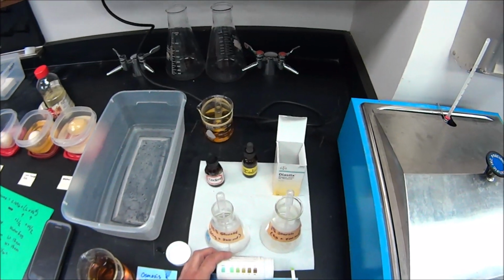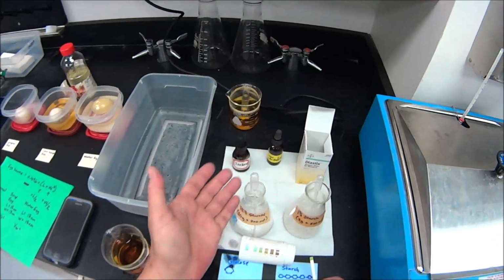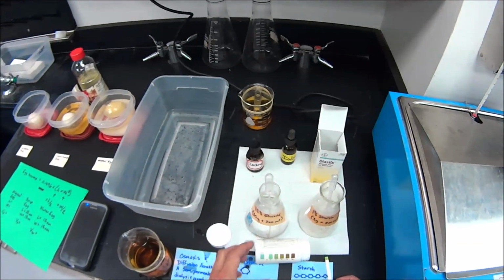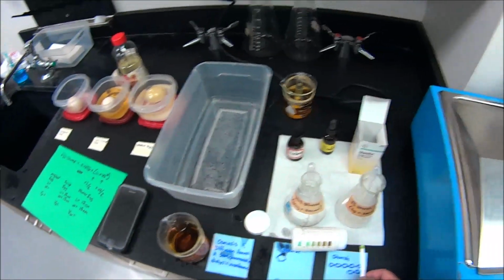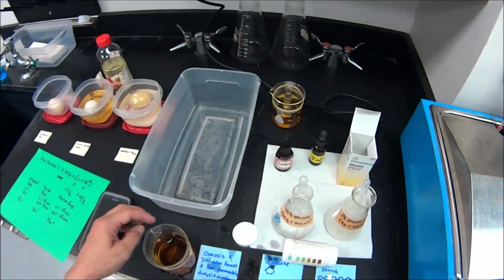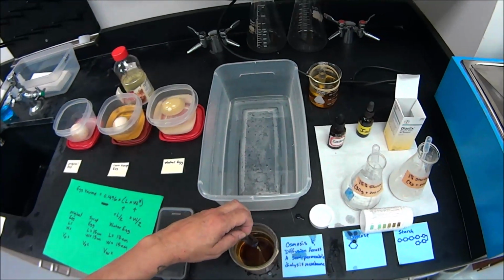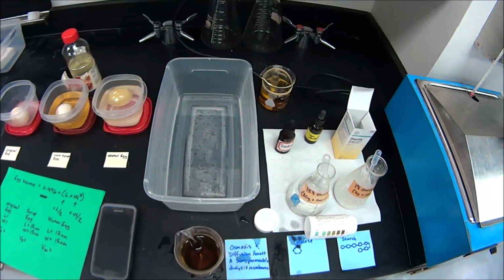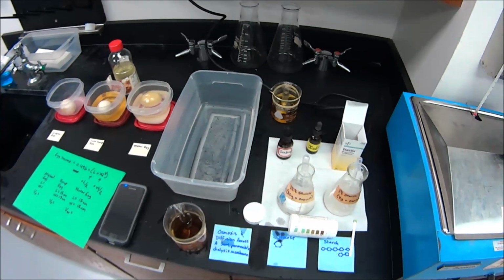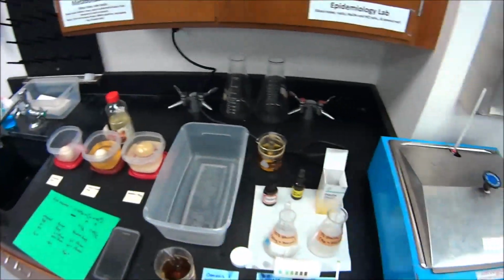What is the name of passive transport by which a small molecule like glucose could move across a membrane to the side where it was in lower concentration, going from where it's high concentration inside the bag to low concentration in the water? What was that term? All right, we'll stop, we'll pick up and check up what's going on in our other experiment.